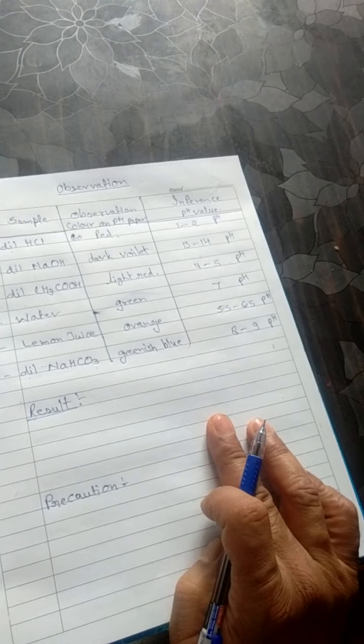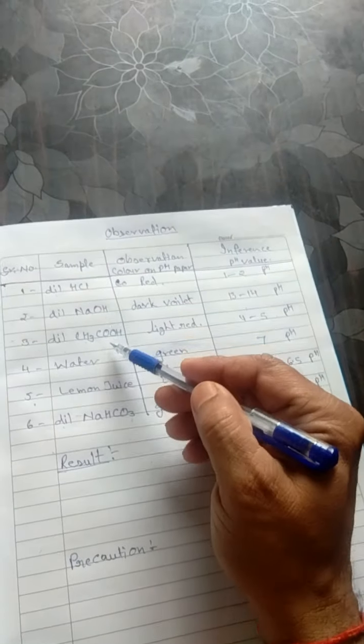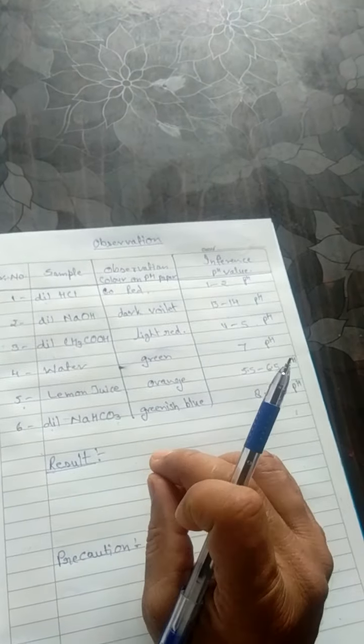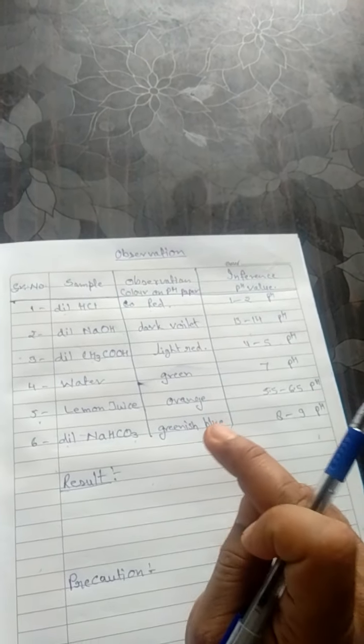Prepare solutions of samples in distilled water. Don't use tap water for the testing. The test tube should be neat and dry before use. It should be clean, otherwise you may get a false, wrong reading. Use a separate dropper for each sample. This is very important. For every sample you will use a separate dropper, or you may wash it properly between every testing, 3 to 5 times with plenty of water. You should wash it after removing the bulb of the dropper. If you are using a single dropper for every test, you should wash it properly, then use it.